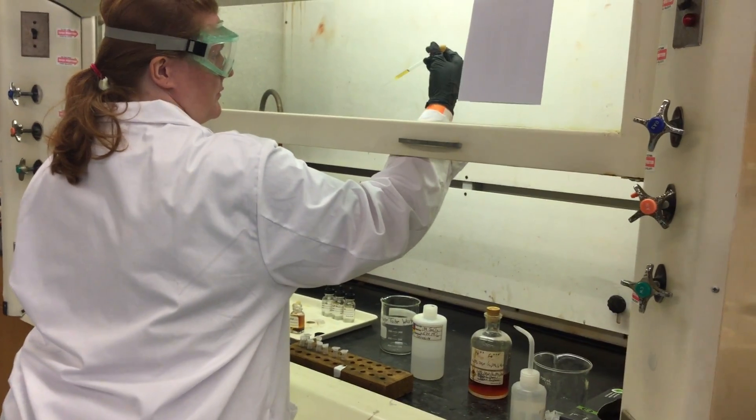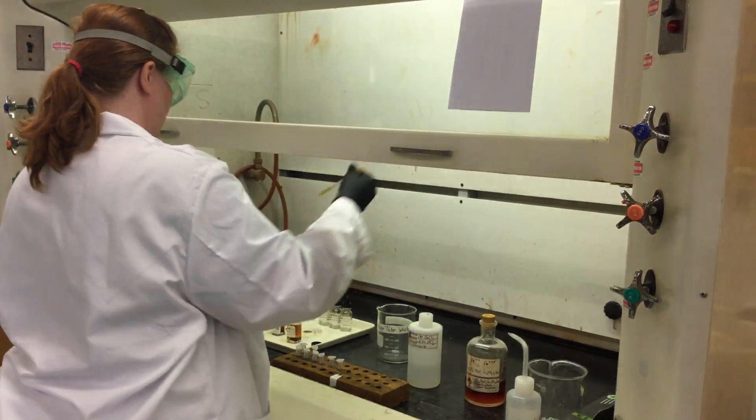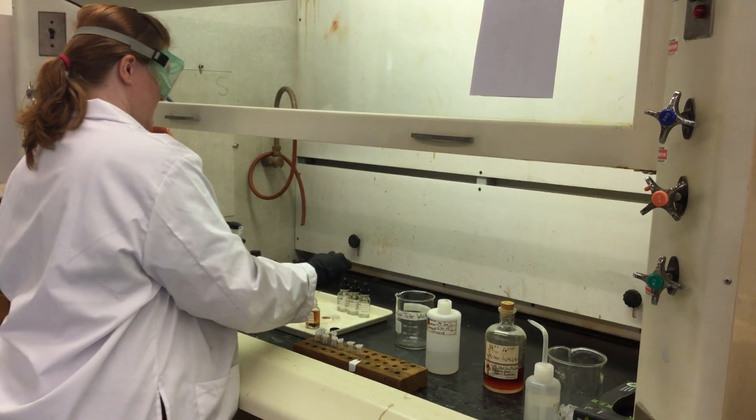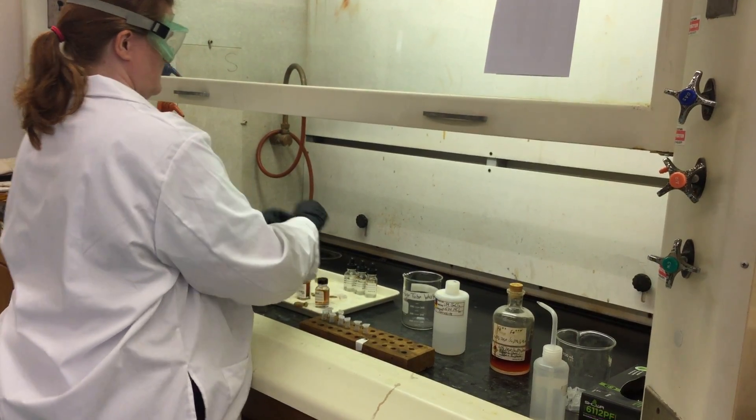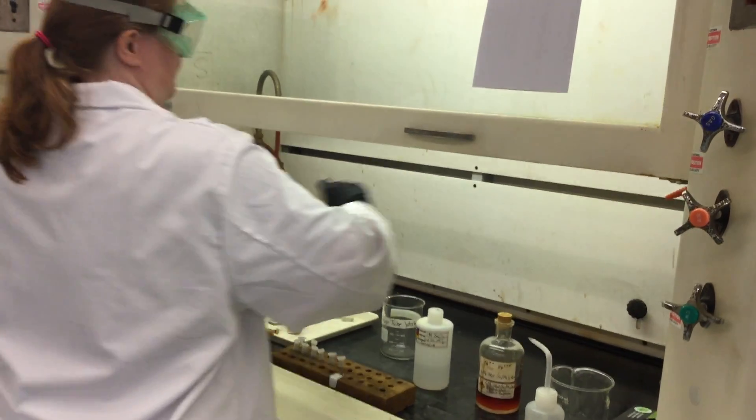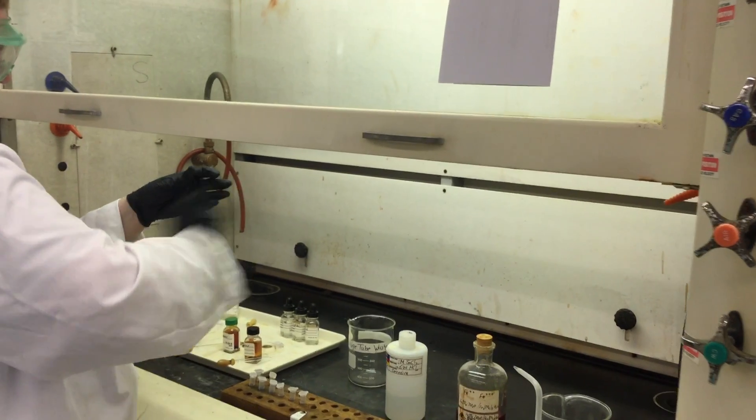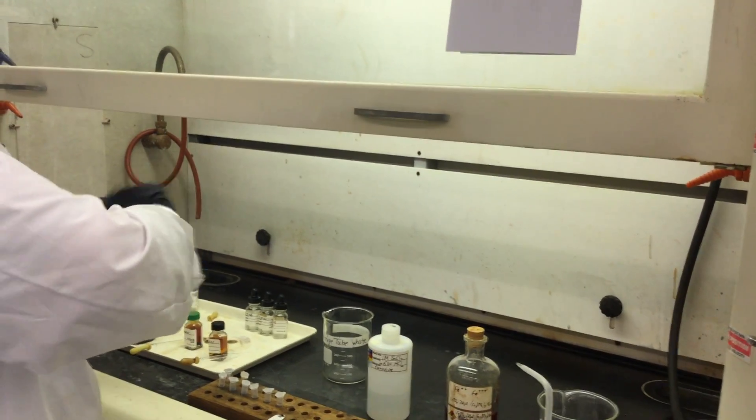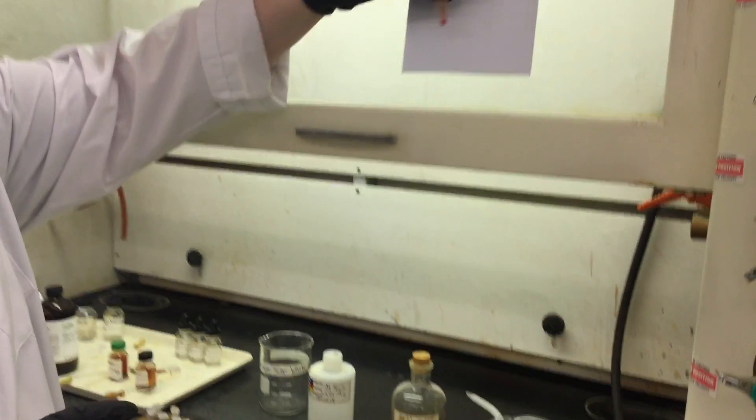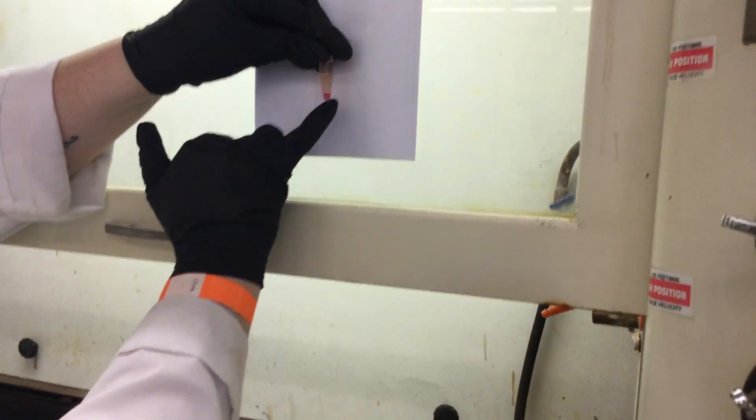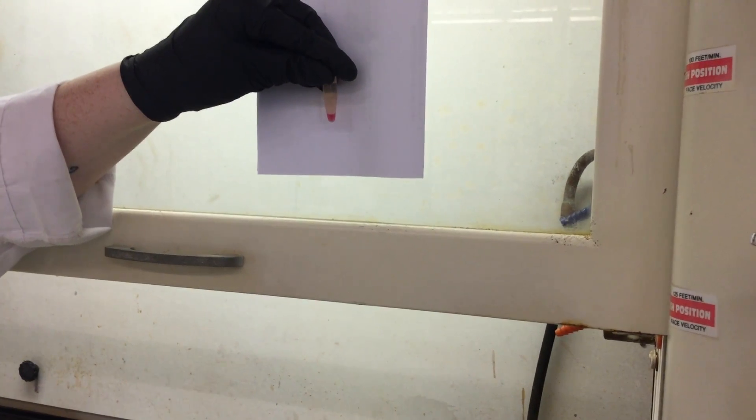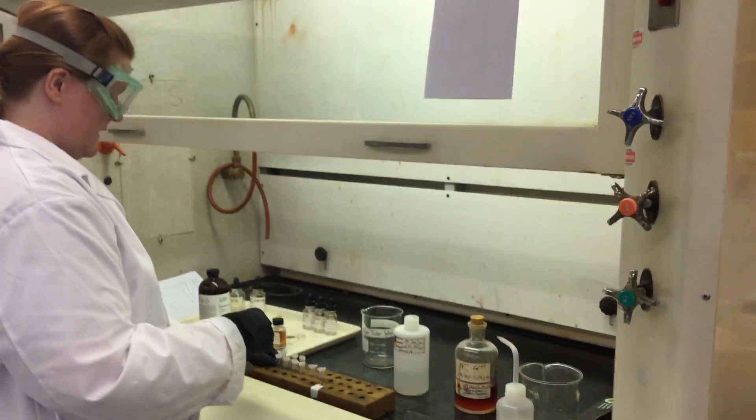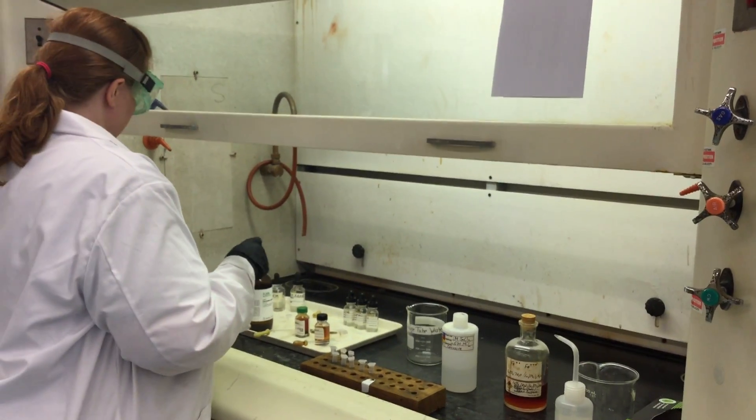This is the color before I put it in the liquid; it's sort of an orange. Okay, so we want to make an observation about what the organic layer down here at the bottom looks like. Those are our standards or controls, if you will.